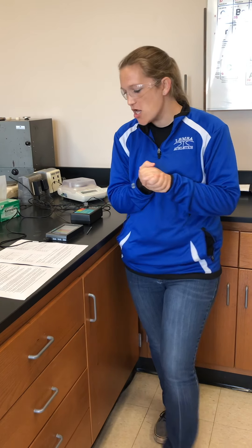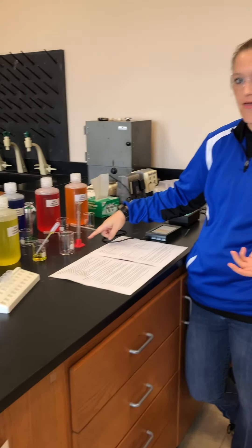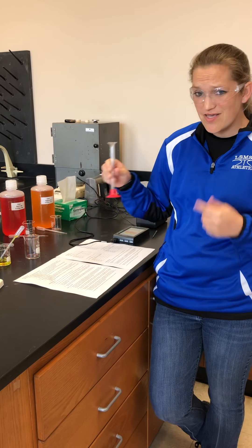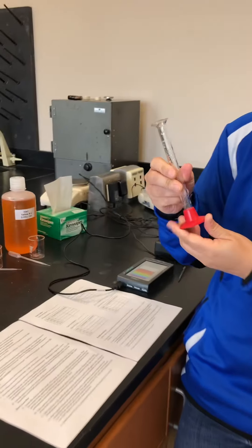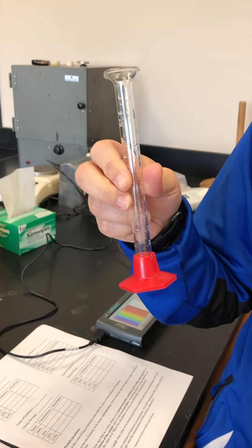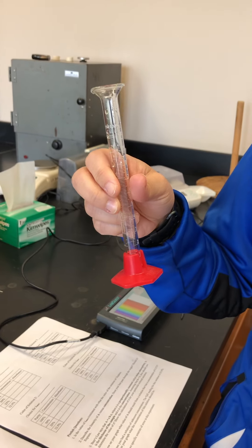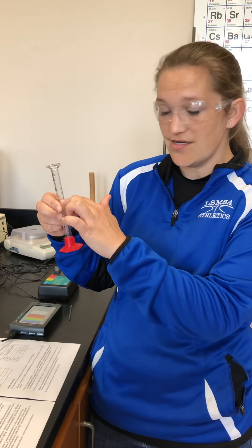Dr. C here. We're going to do the last one, which is 12.5 percent. What I should do is use 1.25 mL and then go up to 10 mL so that we'd be consistent, but it's really hard to get 1.25 on these little graduated cylinders. They're not really designed to be that precise that far down with their measurements. So what I'm going to do is fill it up to 1 mL and then go to 8 mL — and if you do that math, it's the same percentage.